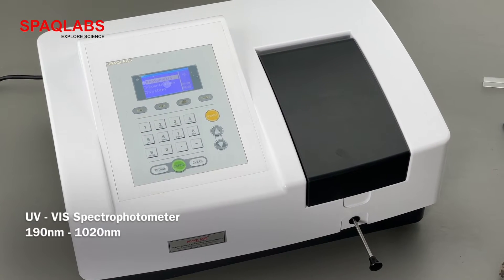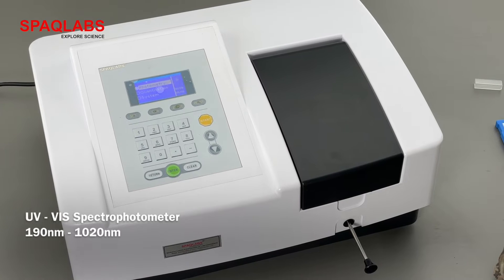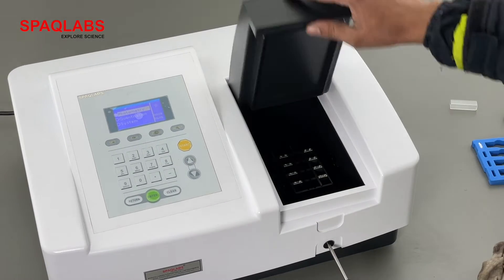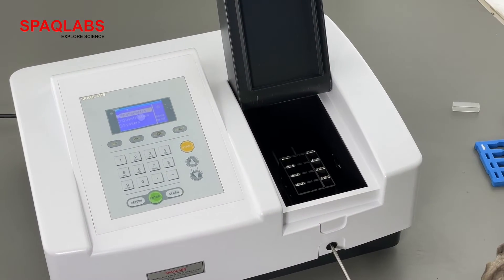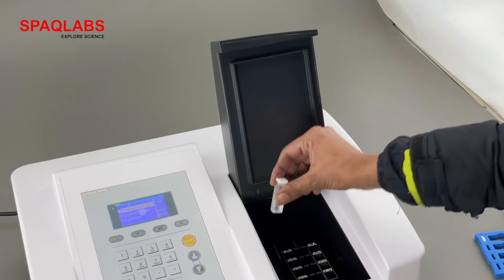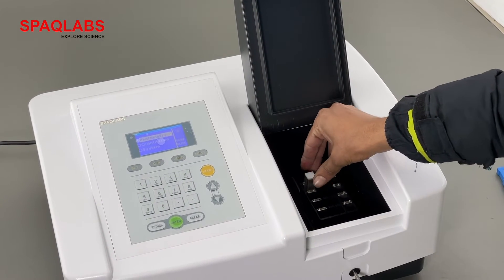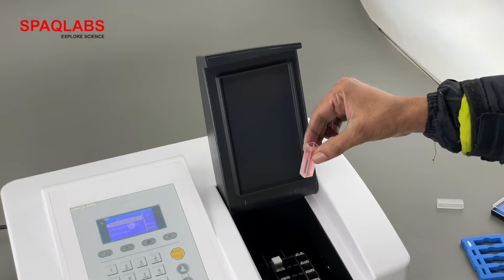This is a UV and visible spectrophotometer. Let's see how to operate it. There is one chamber for placing the cuvettes. First, this is distilled water — we are placing it with the clear side facing like this.